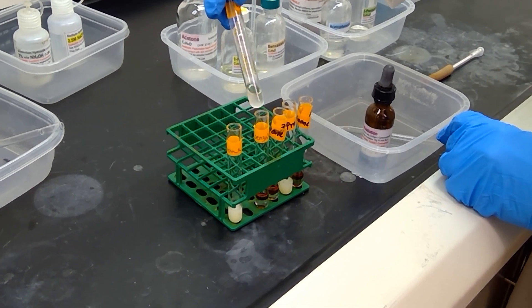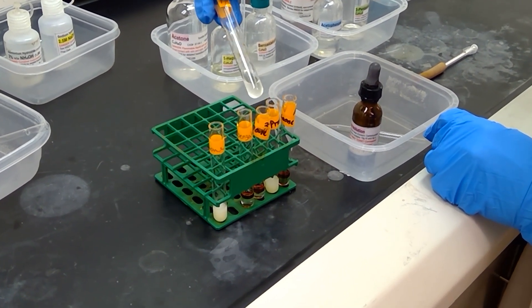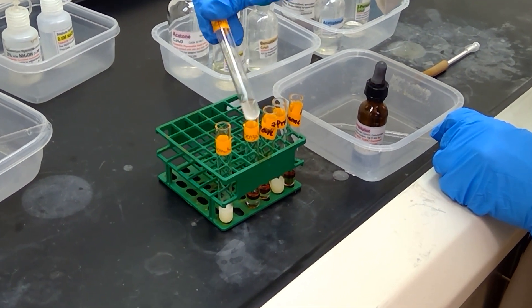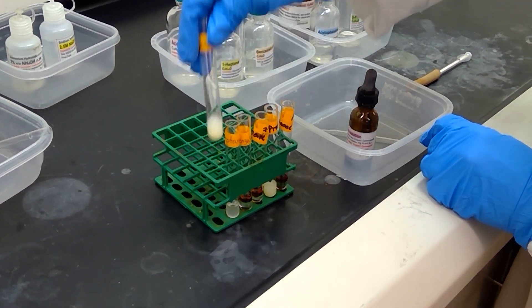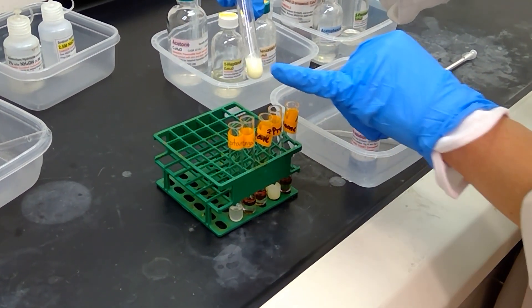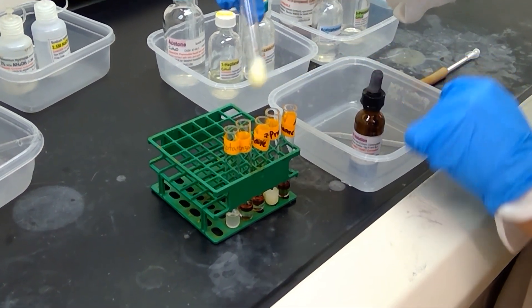For heptanol here it looks like it's all clearing up and I don't see any precipitate. For acetone we definitely have some very yellow precipitate forming in the test tube.